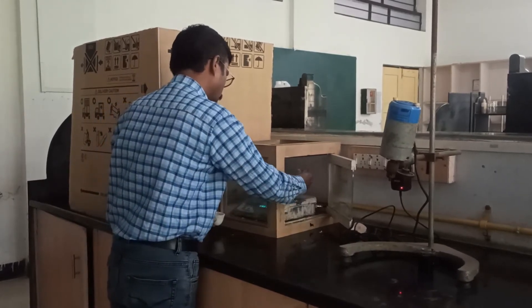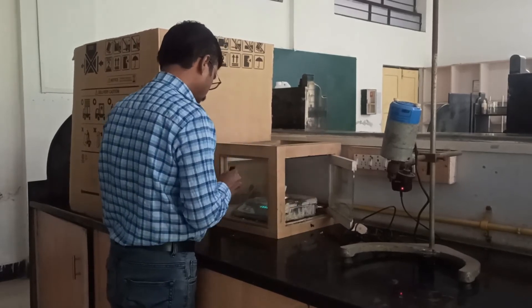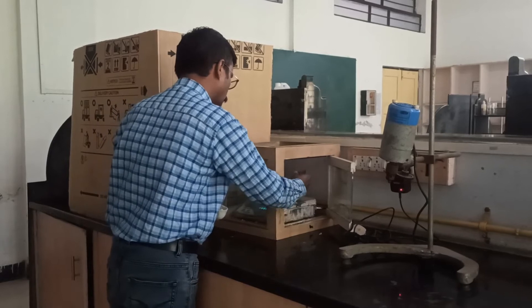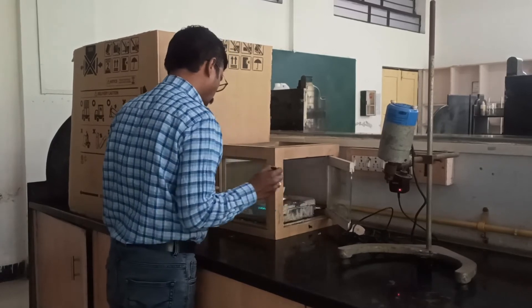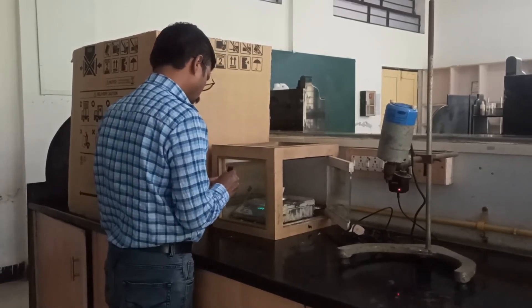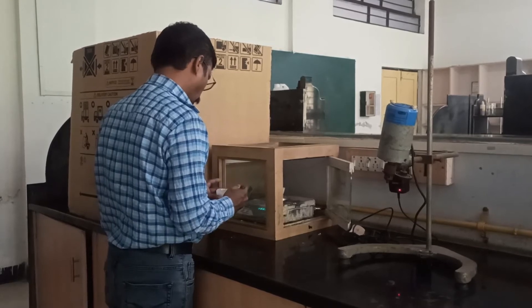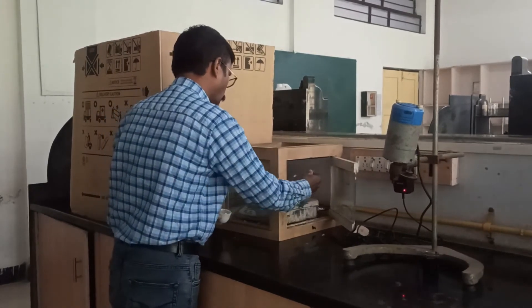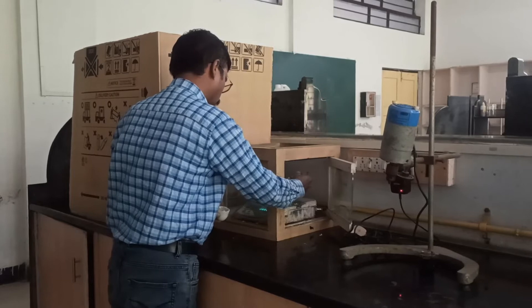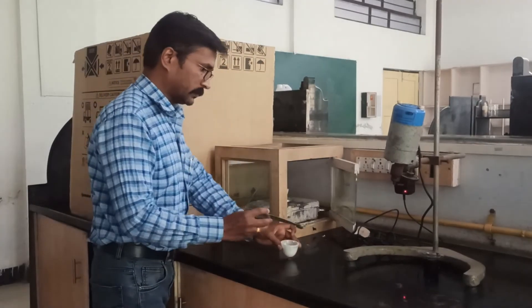Here we have placed 5 grams of soap sample in a crucible. Now we will place this sample with crucible in a hot air oven for one and a half hour at 100 degrees Celsius.